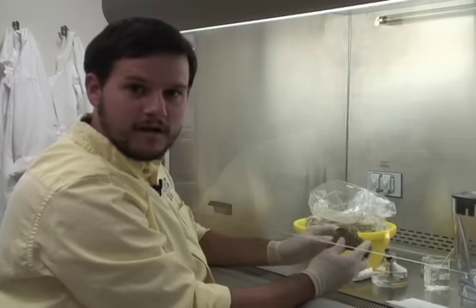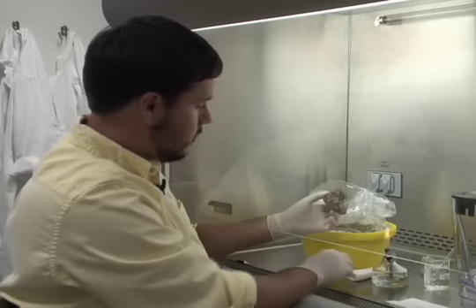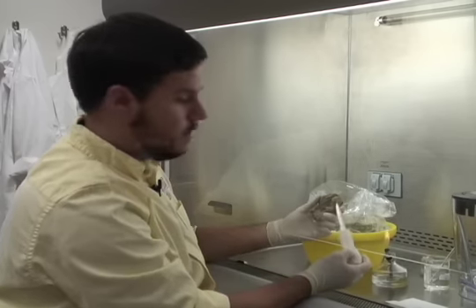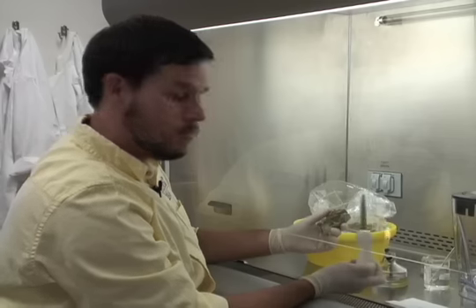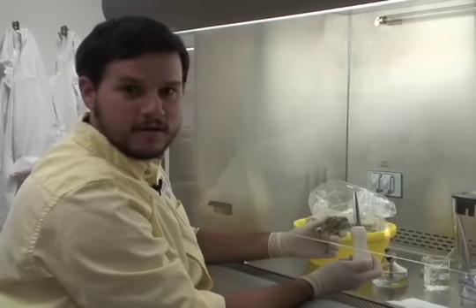They get in in about an hour. It's pretty efficient. Once we do that, we've got to get them back out again. We're going to shuck these oysters and then blend them up, and that way we can recover the bacteria.